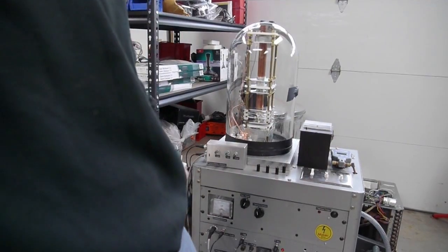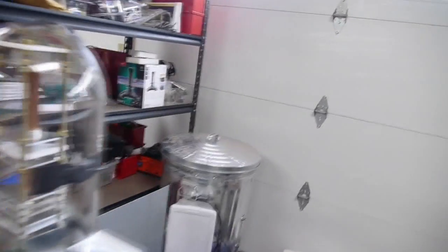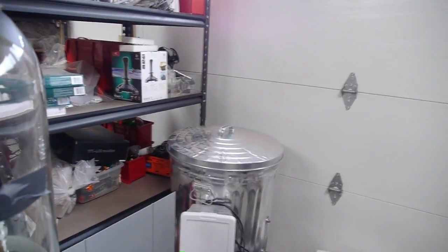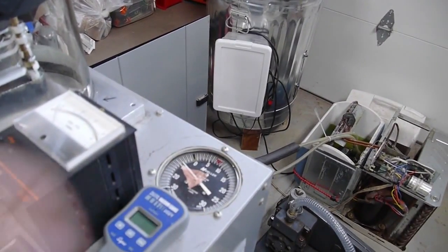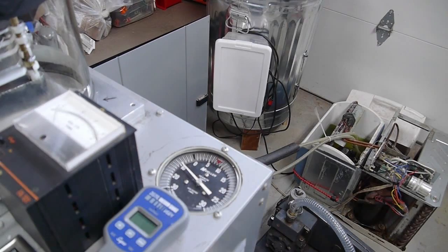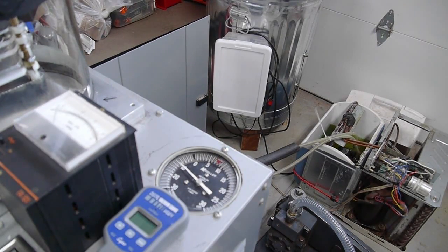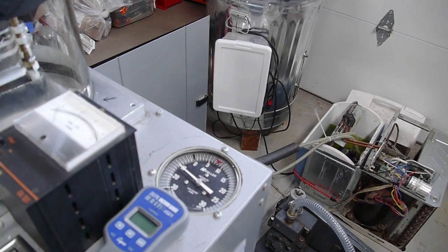Air is being pumped out of the chamber now and on the first of the three vacuum gauges, the one that indicates the highest pressures, you can see the needle starting to come down. This will take five to ten minutes to get to a vacuum where that mechanical gauge can't read anymore. So I will see you in five to ten minutes.